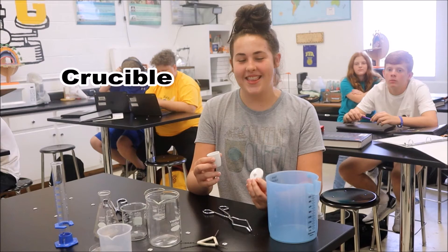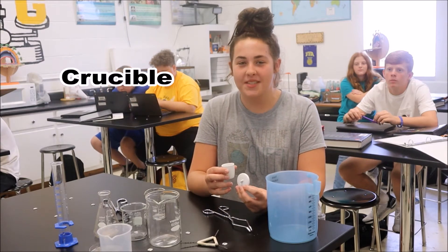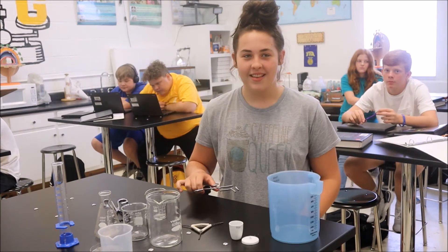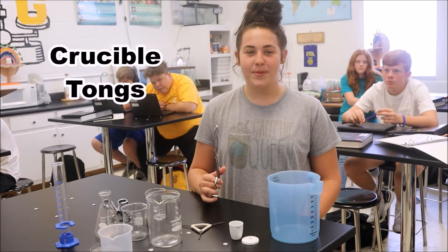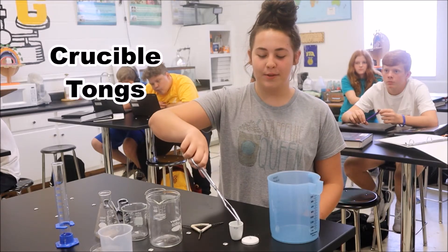This is a crucible and lid. It is used to heat up substances in the lab. These are crucible tongs. They are used to pick up the crucible.